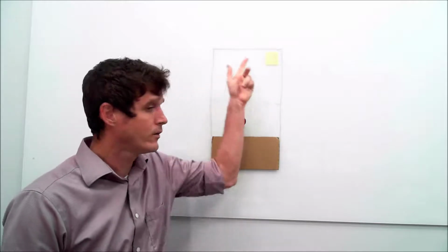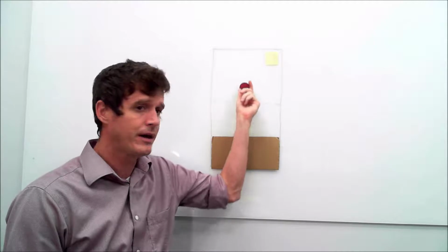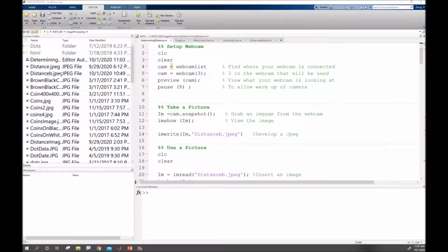And so I have a rectangle that I'm working with. My brown square would be my sediments, and then the pipette we're going to mark somehow to where we can move it up and down to be able to record the distance between the two. Let's open up Matlab and take a look at it.